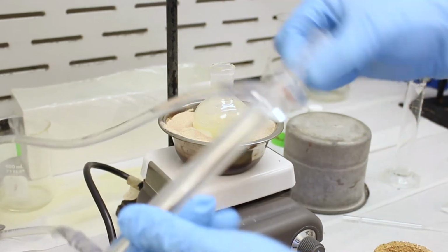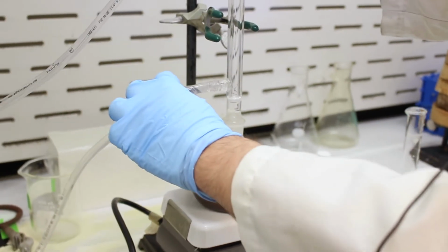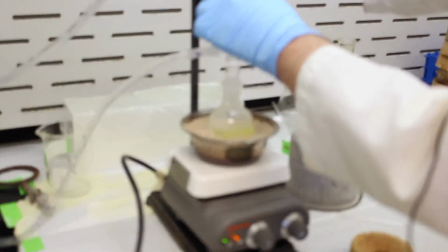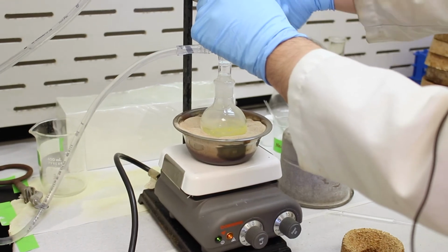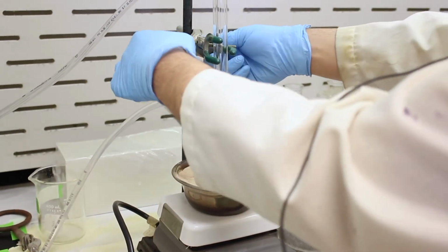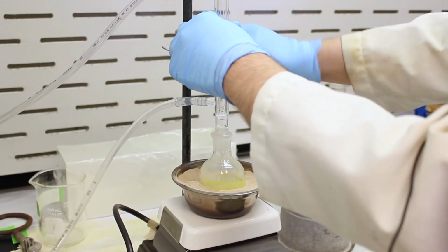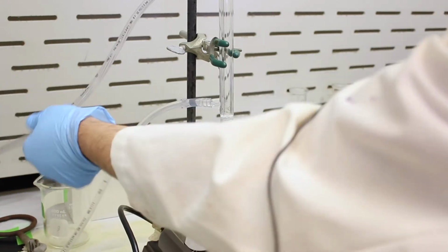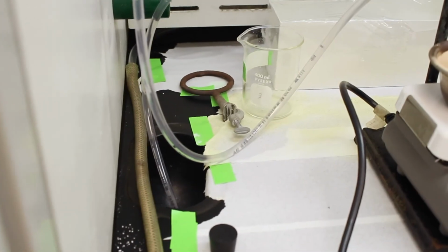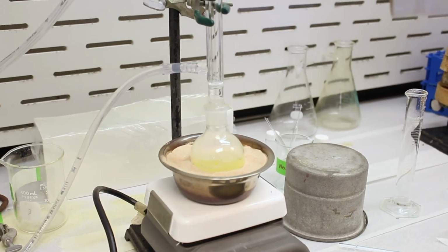Okay, so we'll take our reflux condenser. This is supplying cool water from the sink. Make sure we have a good seal, and then we'll clamp it loosely. This doesn't have to be super tight, it's just to make sure it doesn't tip over. Make sure the outlet is in the sink, and then we'll turn on the water. Alright, that should be good. So now there's cool water entering here and exiting here.